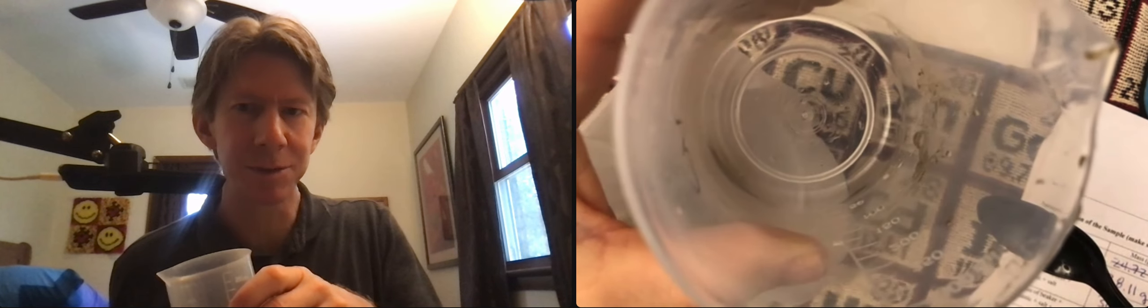And I don't know if you could see how much sand was in there before, but the vast majority of it is now over. Let's do it again.